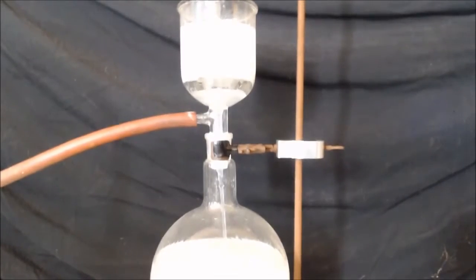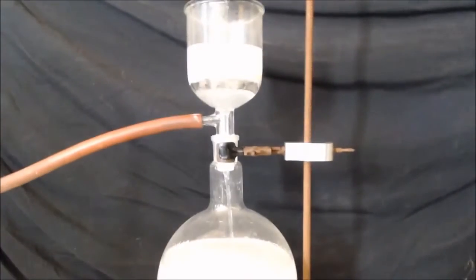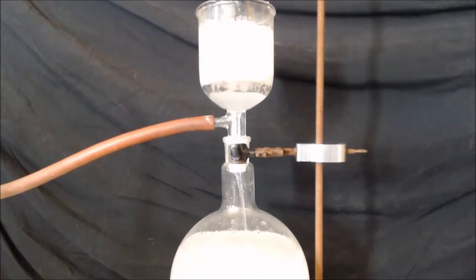And once you get your suction thing, see I got a valve there? See that valve? I can shut it off and keep the vacuum on. And I can keep that shut. I don't have to have it. I don't have to worry about the noise, I don't have to worry about the vibration, I don't have to worry about the oil being spurted out.